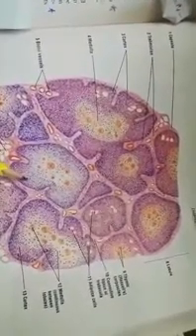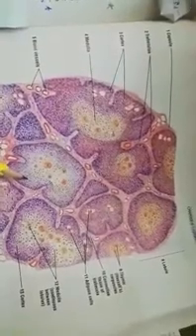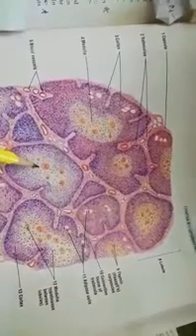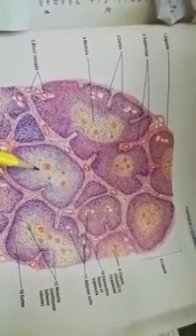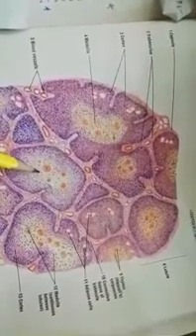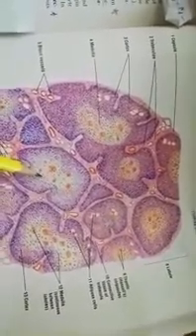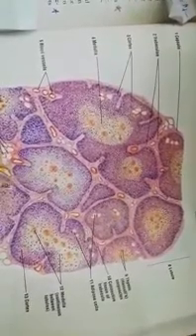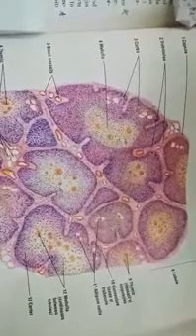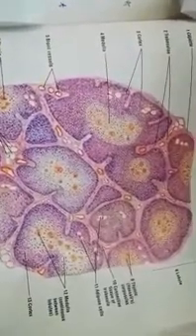The proportion is that the T lymphocytes are maximum in number in the cortex, and in the medulla this ratio is reversed. The T lymphocytes are lesser in amount and the epithelio-reticular cells are maximum in number. These epithelio-reticular cells show both qualities of the epithelial cells and the reticular cells as well.